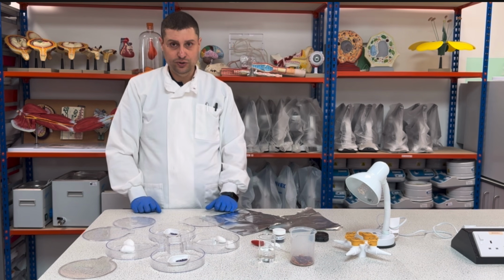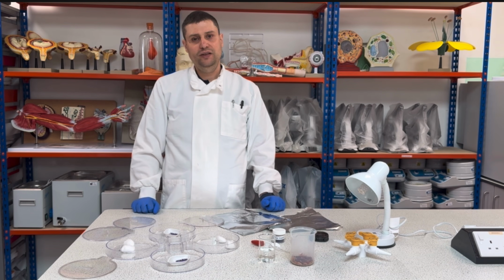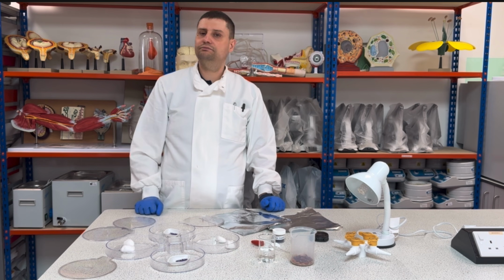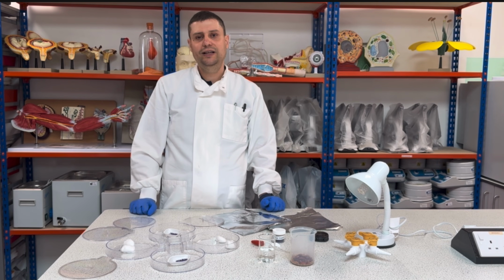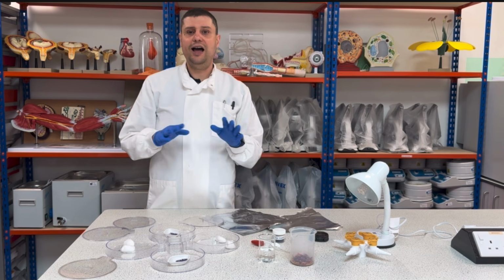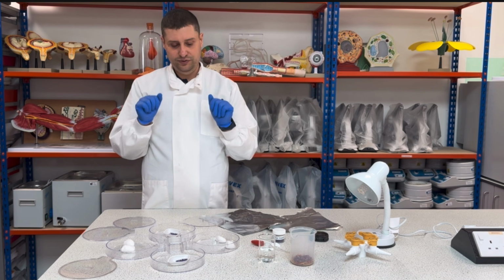No, for this practical, because these maggots I use for fishing, so I didn't collect them from a cadaver of an animal somewhere. So these maggots are not dirty or infected with any kind of disease. But some people don't find it pleasant to deal with these animals, so gloves are a good solution. I am fine with it, but as an example, I'm wearing gloves.